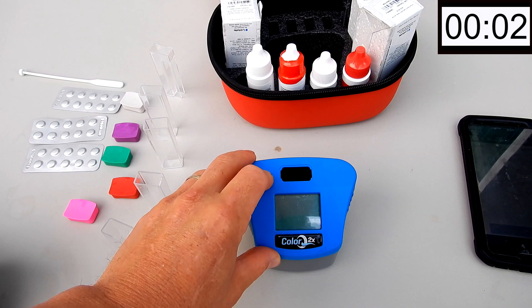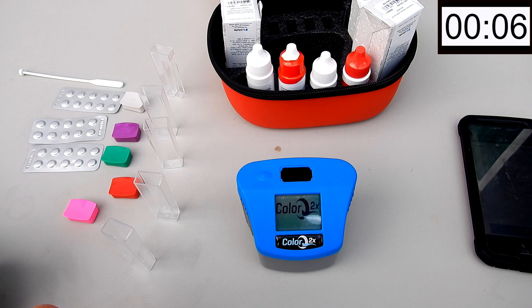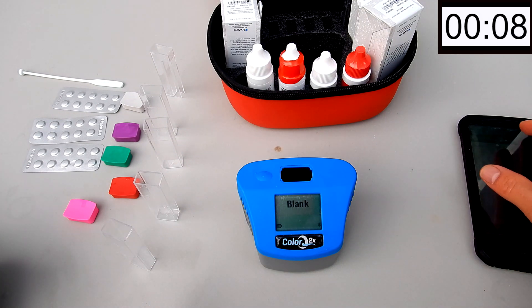We're going to do the testing in real time for you and we're going to turn on the 2X here. I have the water sample and we connect it to the app.